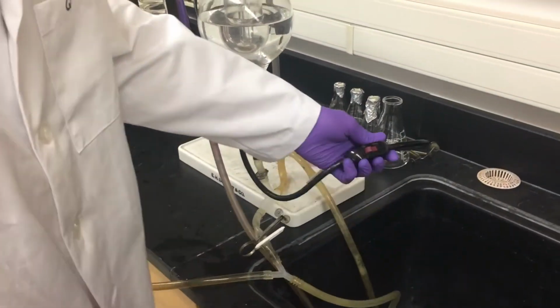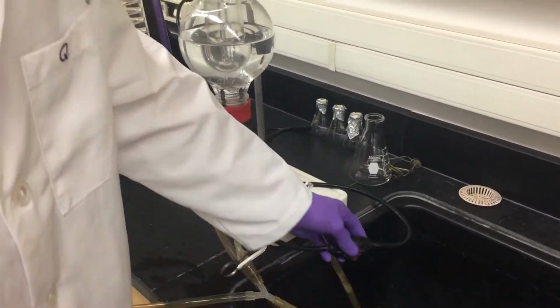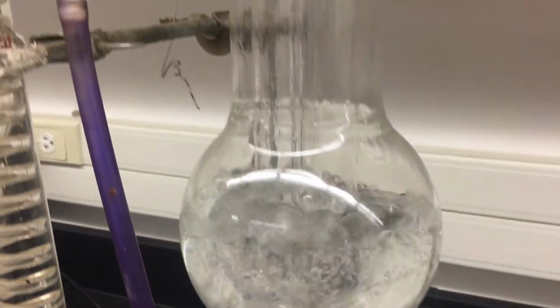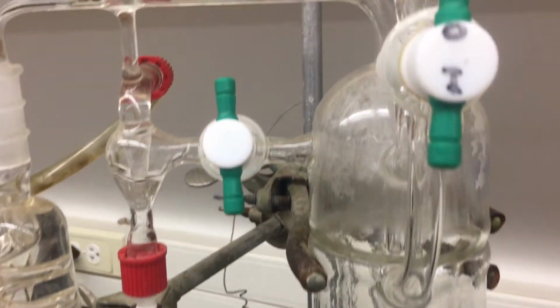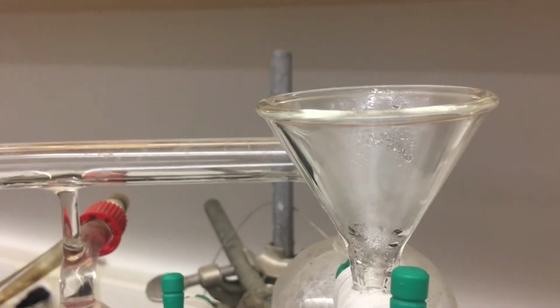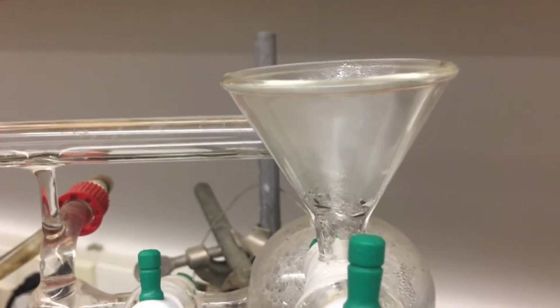With the stopcock still indicated for the outer boil chamber, slightly turn on the water pressure and turn on the heating element. Allow the distilled water in the boil chamber to boil, releasing vapors to the top funnel. This will help remove any imperfections that are remaining in the water.